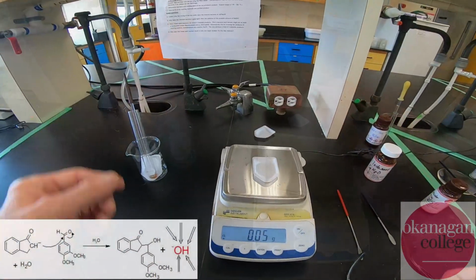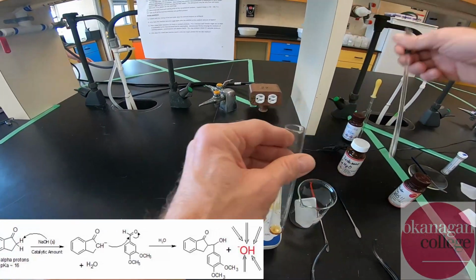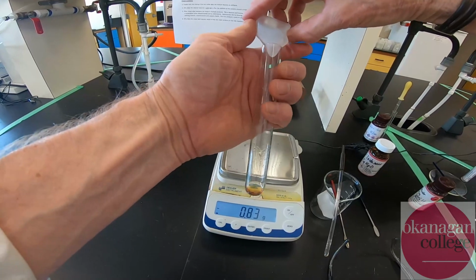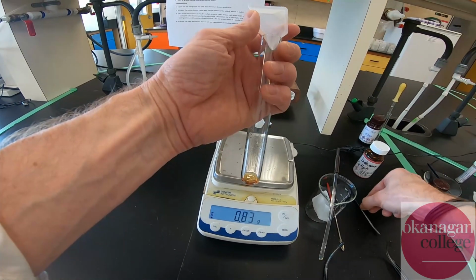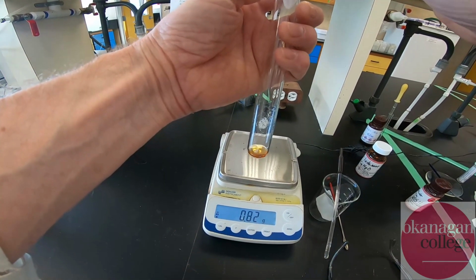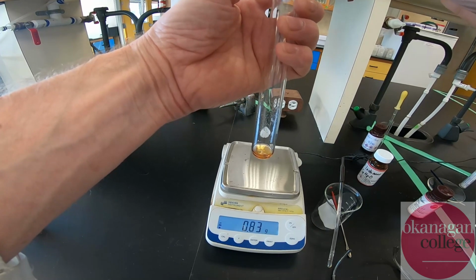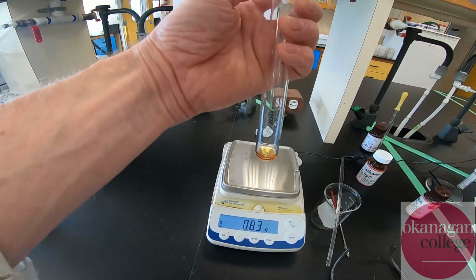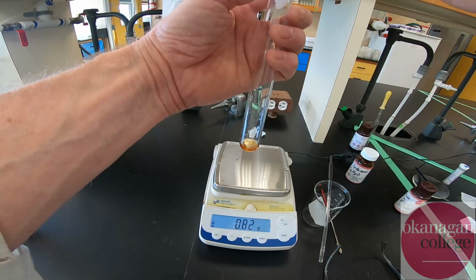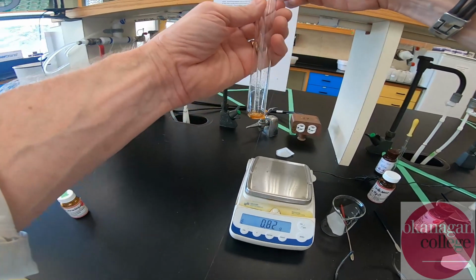Okay, so we're going to be transferring the sodium hydroxide to the test tube. Because of static electricity and the fact that sodium hydroxide is hygroscopic, meaning it picks up moisture, sometimes that transference is a little difficult. So I'm going to aid that with a little bit of help with a spatula and transfer the material that way. Okay, there we go. So I've added the sodium hydroxide and off we go.